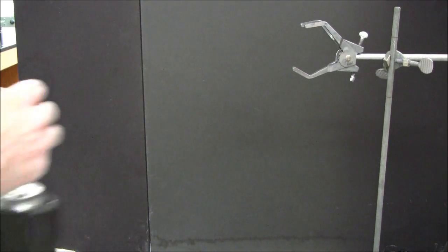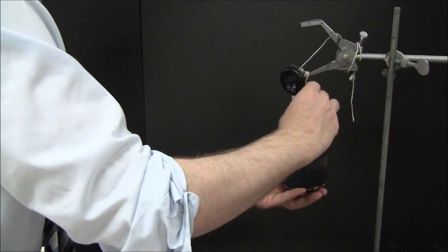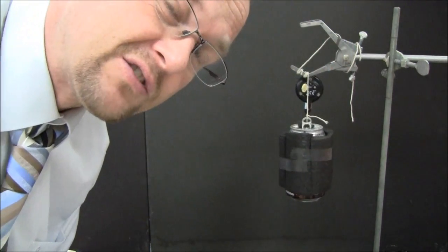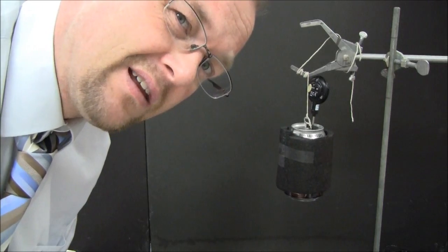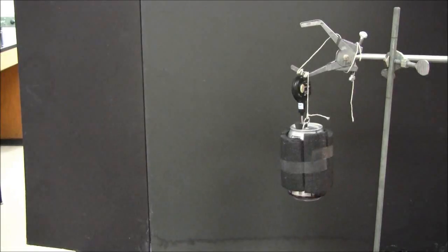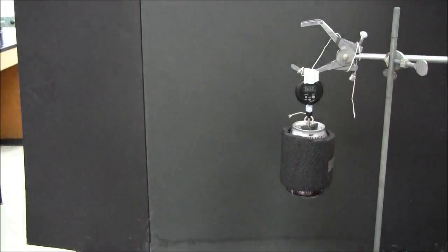Let's string up the calorimeter. So I want to measure the temperature of the water, so I'm going to make sure that the thermometer doesn't touch the bottom of the can, but that it's in the water.